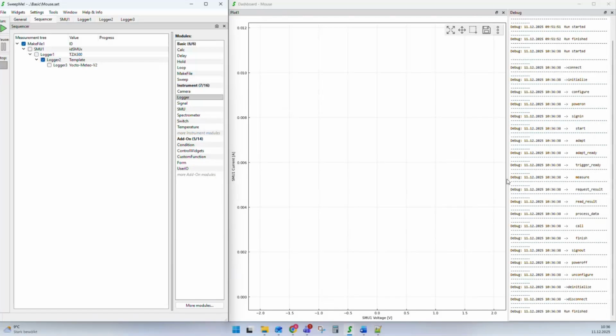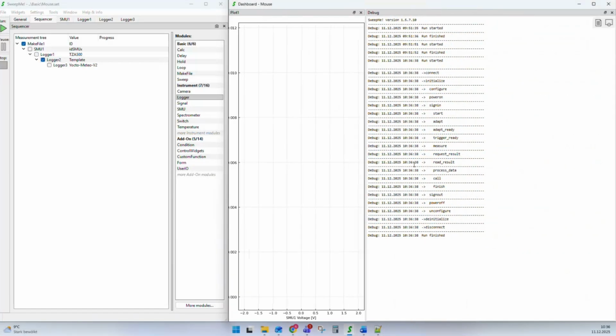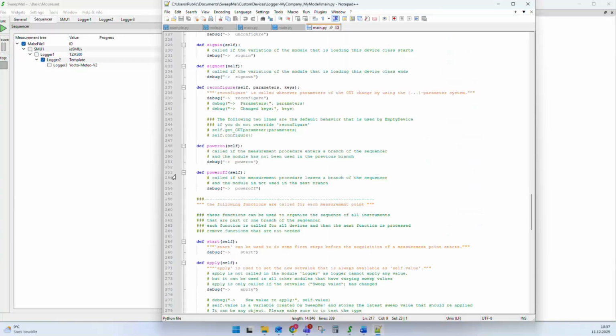And what you can see now in this measurement, we were running through a single point. It means we created in the SweepMe sequencer just a single measurement because there is no repetition module. There's no module that creates a sweep or a variation. The logger module itself does only create one variation to create one measurement point. And now you can see that it creates debug commands like connect, initialize, configure, power on. And this helps you maybe to understand and to see when these functions are called.